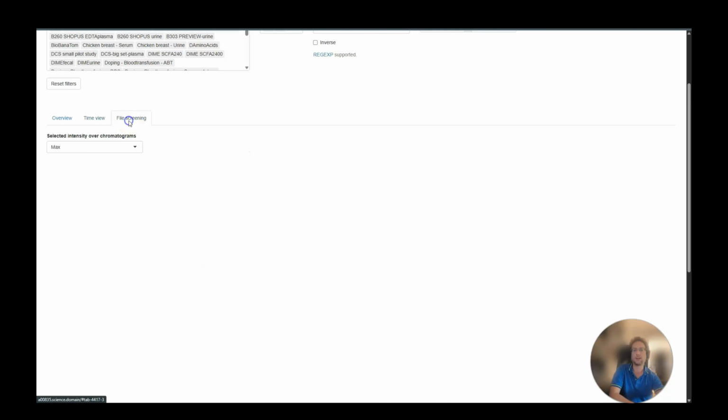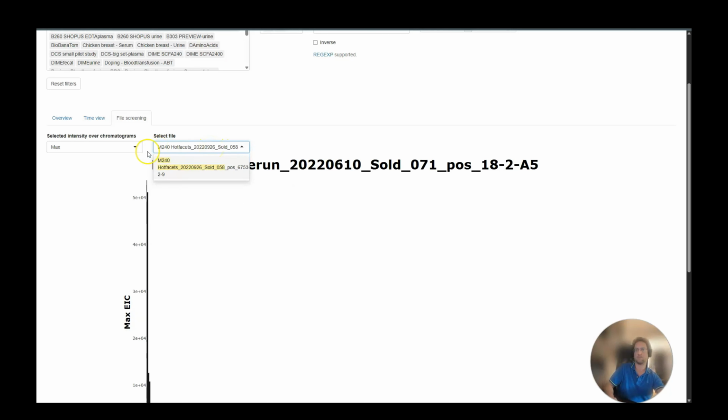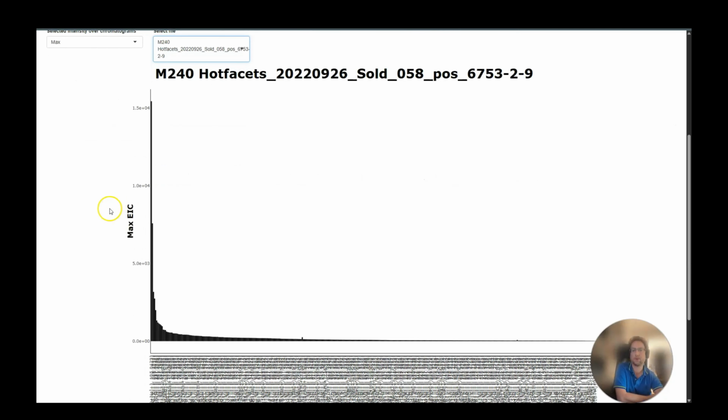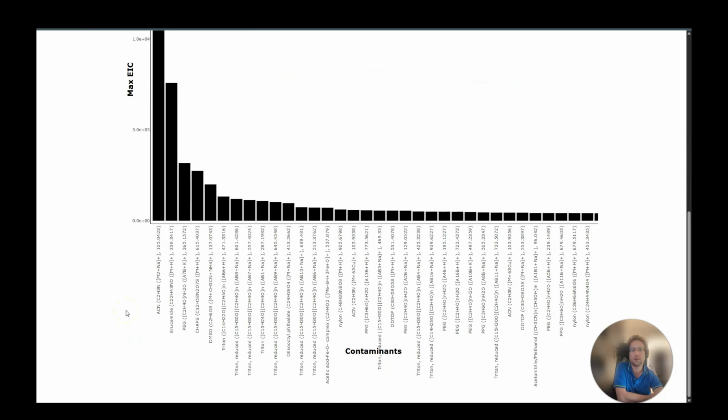Finally, we can also go to the last tab and select a specific sample. Then you will see an overview over all the contaminants that have been found in that sample. We can zoom into the start here and see what the most prominent contaminants are. So here it would be acetonitrile followed by erucamide and a PEG and a lot of other detergent-related ions.